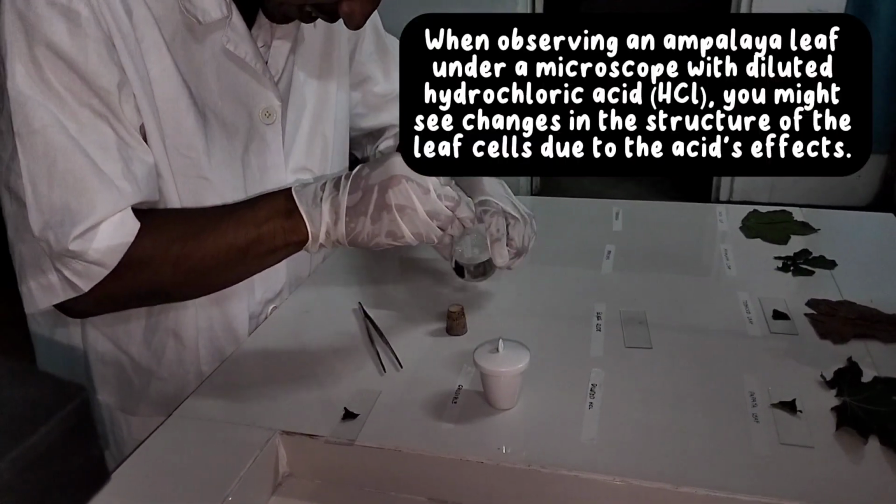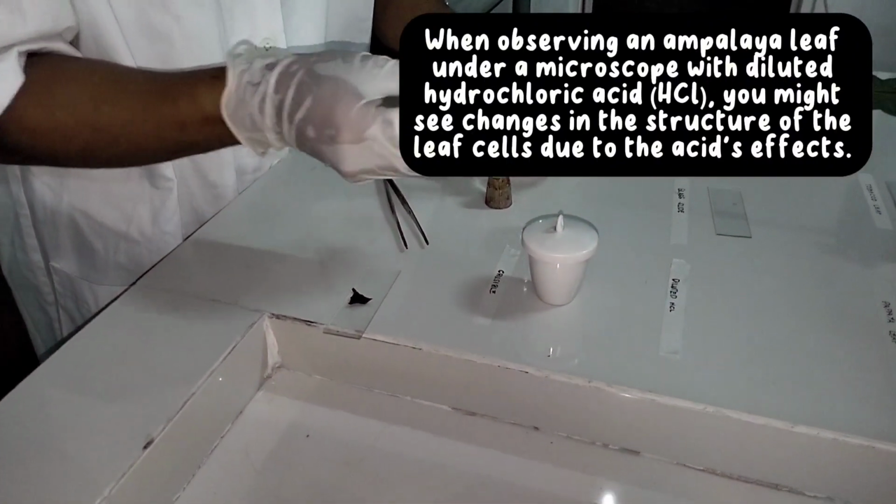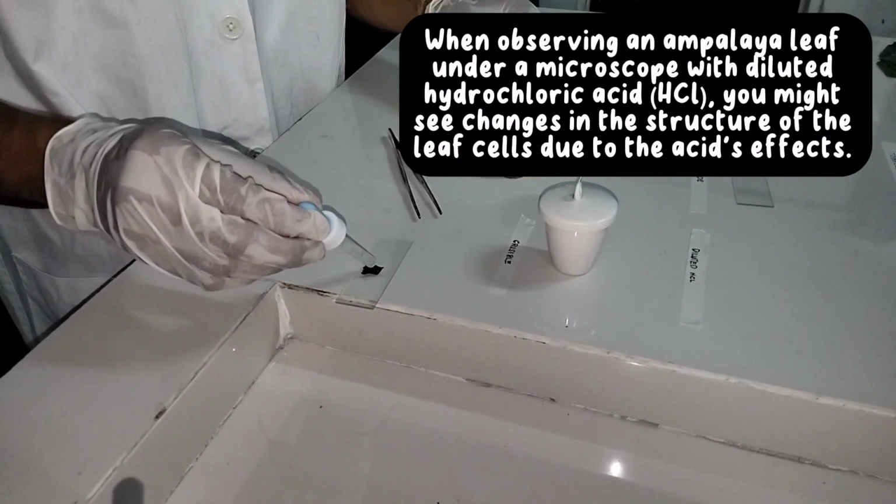When observing an ampalaya leaf under a microscope with diluted hydrochloric acid, HCl, you might see changes in the structure of the leaf cells due to the acid's effects.